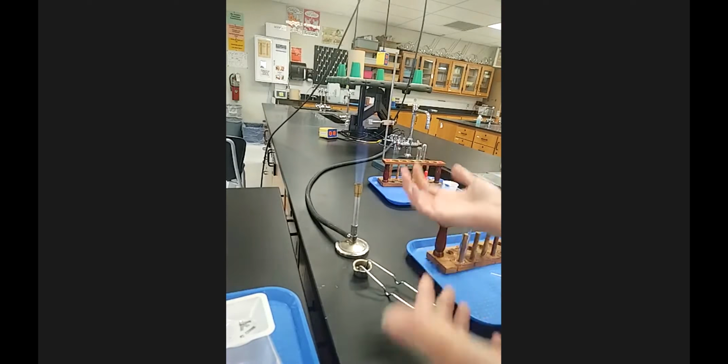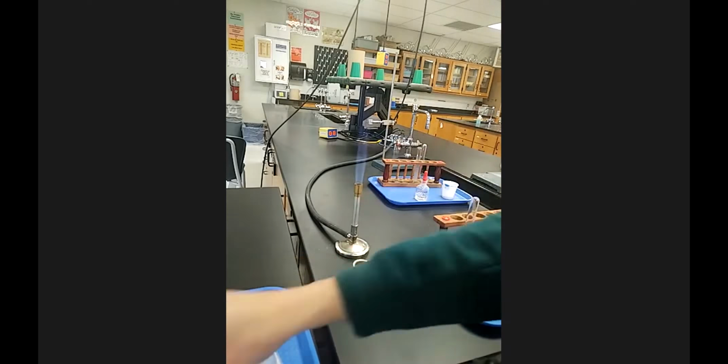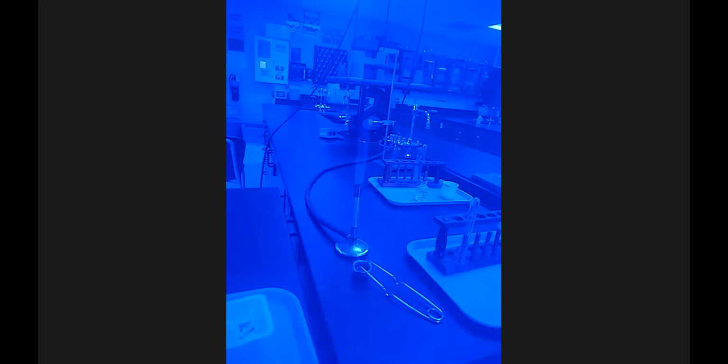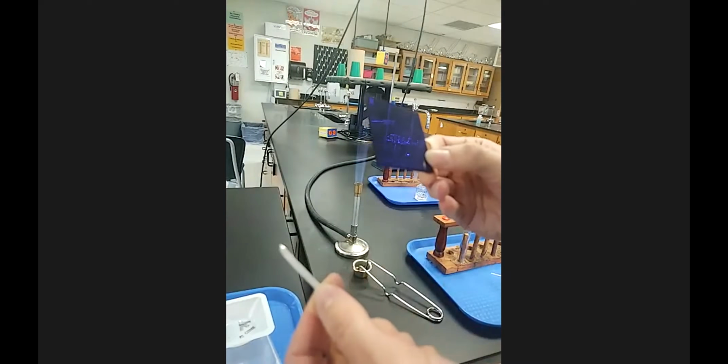So you'll see the Bunsen burner is going to be on now for a while. So if you see observations that you want to make with methane burning in the air, there it is the whole time. Okay, so station 8 is just ongoing because I'm using the Bunsen burner for many stations. But I'm going to take this magnesium and burn it in the air. Now, we're going to view it with our naked eye, and then I'm also going to put this piece of cobalt glass over my phone, not with my hand in the way, sorry, as a filter, because you can actually see something different when you burn this with the lens versus without it.